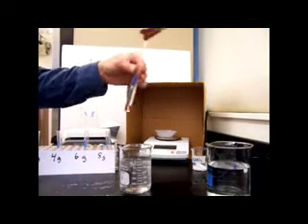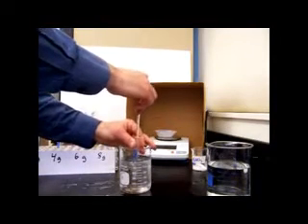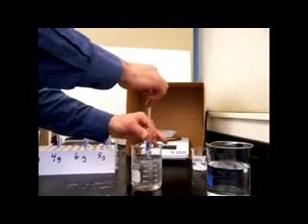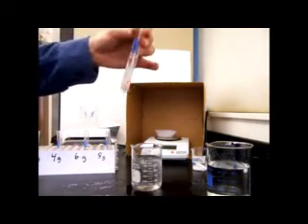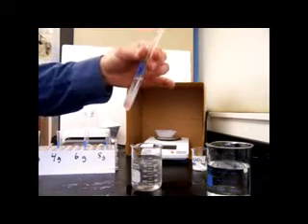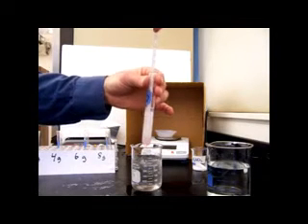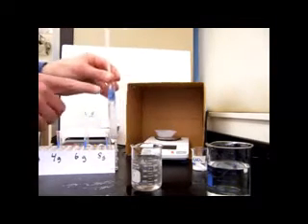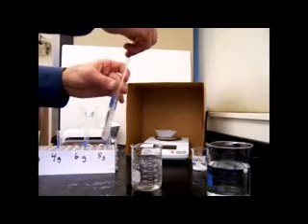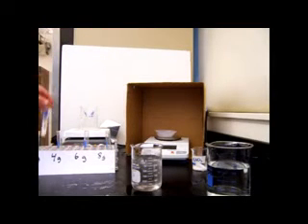So we're cooling it. We're down to about 40 degrees now. Still don't see any of the salt particles. So we'll cool it a bit more. Move it around in that solution. And here we have some salt particles starting to form now. You see it came out of solution. And we look at the temperature right now, and it's 25 degrees Celsius when those particles came back out of solution. So the saturation point for the solution with 2 grams of potassium nitrate in 5 milliliters of water was about 25 degrees Celsius. If we heated this back up, we could get the solutions to go back into solution.